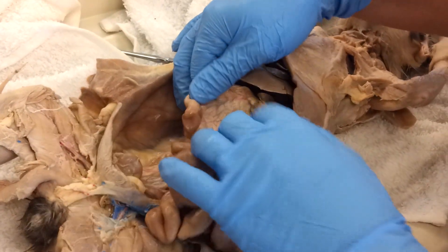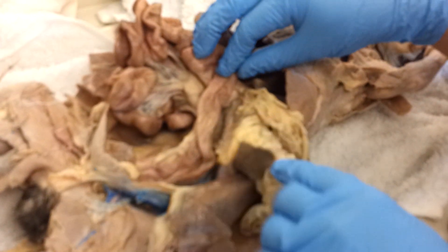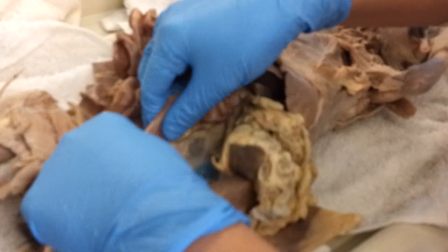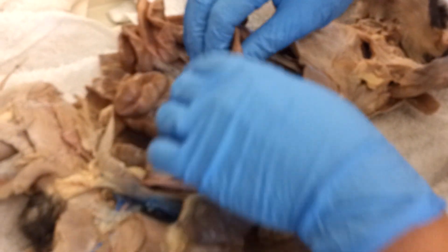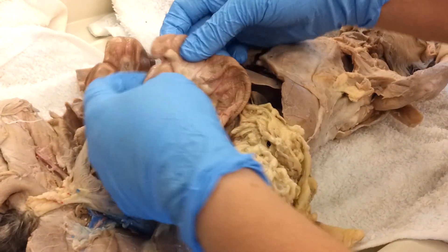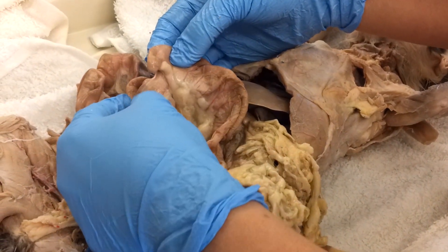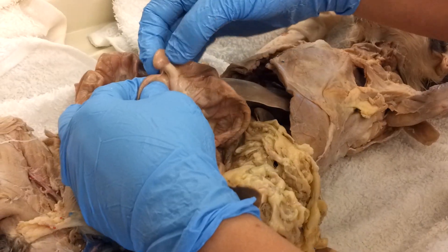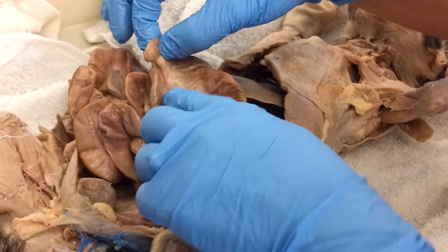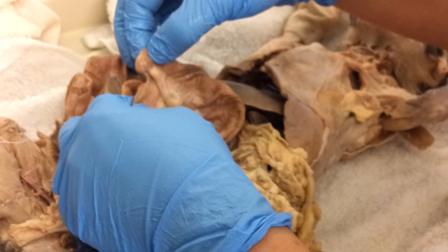You can follow to the end of the small intestine. Sometimes for finding this, if you start at the end of the GI tract it's easier. This is the rectum right here, and that's the last part of the colon. If you keep going up and around, you will eventually get to a little sac right here — this is the cecum. That means this is the end of the ileum right here, and where the ileum joins the cecum we call that the iliocecal junction. There's a sphincter valve in there that keeps chyme from moving from the ileum to the colon until all the nutrients have been absorbed.